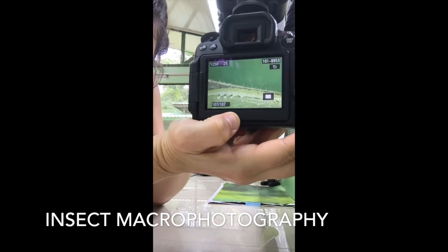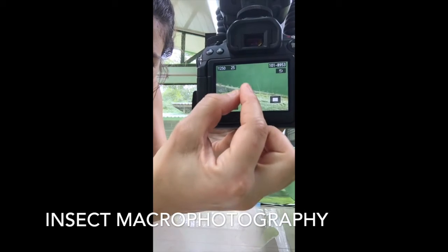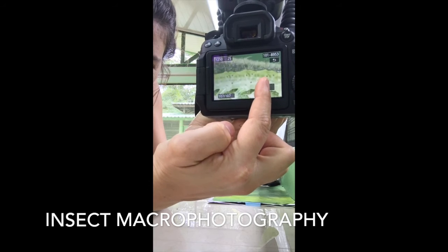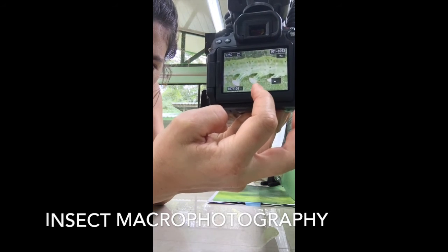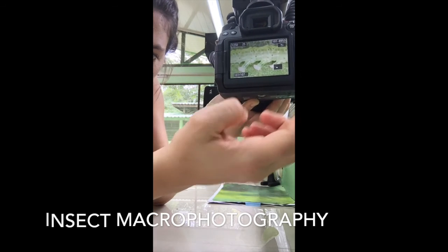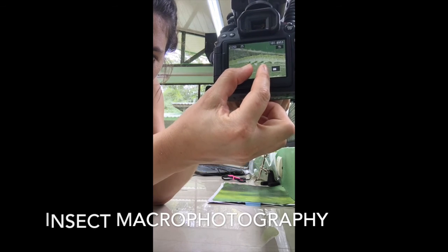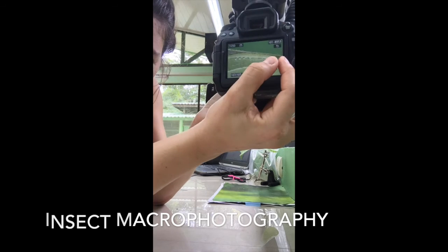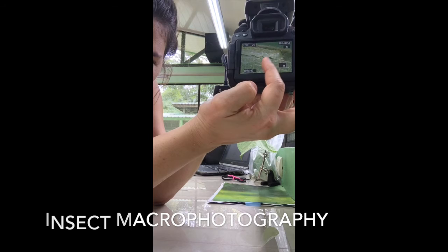I don't know if you guys can see there, is it has really long hairs on it. And you can see the details in, this isn't the best shot, but I just wanted to get a quick example for you guys. You can see its prolegs with the crochets. Those legs will be lost after it goes through metamorphosis, and the only legs that remain are these true legs right there.